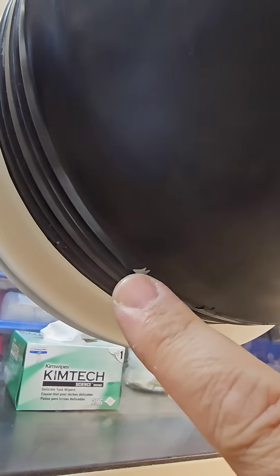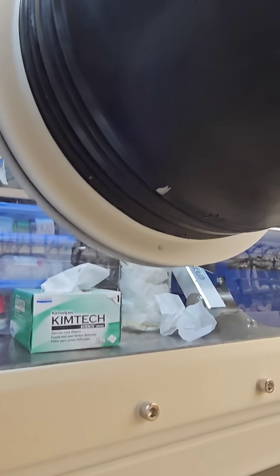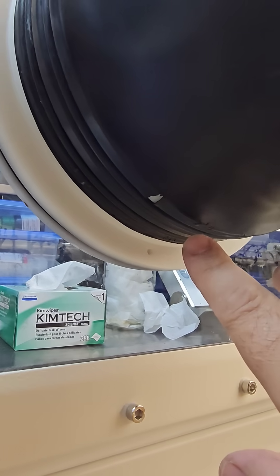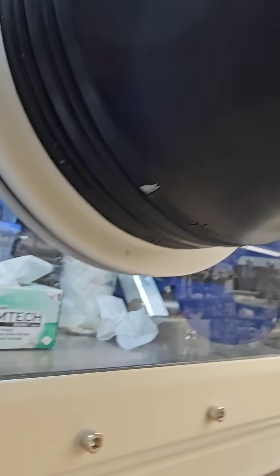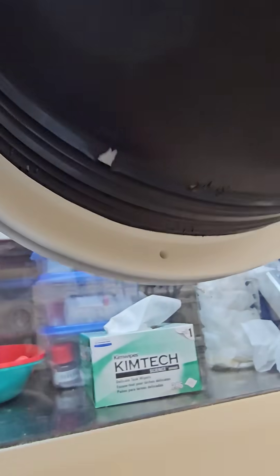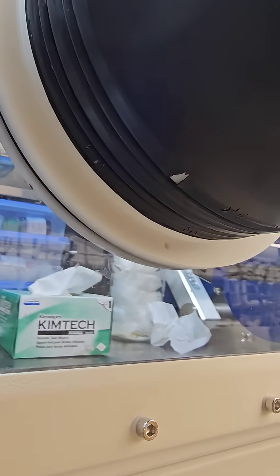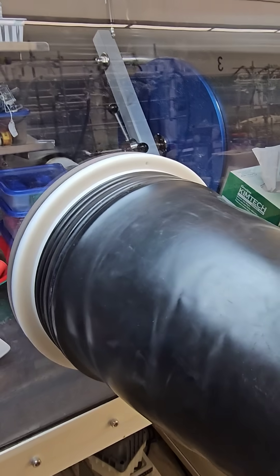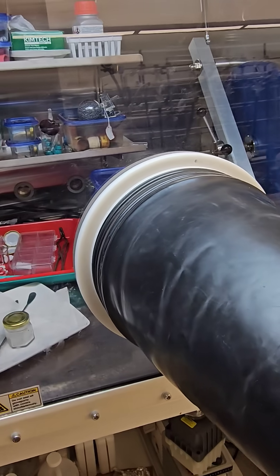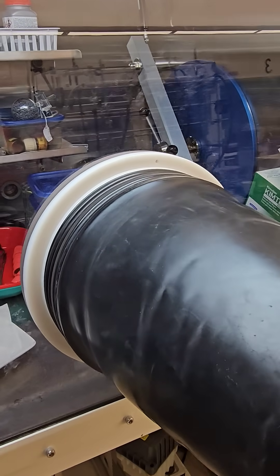Today I did a visual inspection on the gloves, and yeah, that's not good. So even though this glove has really not seen any mechanical wear, it's been on here for several years and it's basically gotten a little bit brittle. And so as myself and students have worked in here, it's worn it away just enough that it makes a very, very, very slight leak, but nothing that is absolutely catastrophic. So it's taken me a while to track that down.